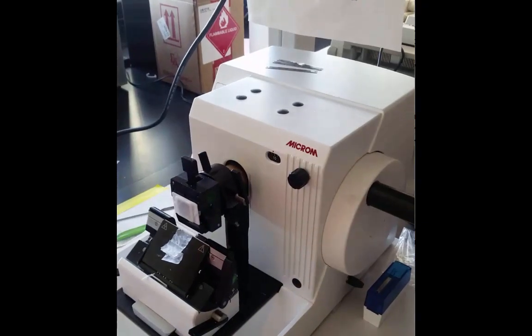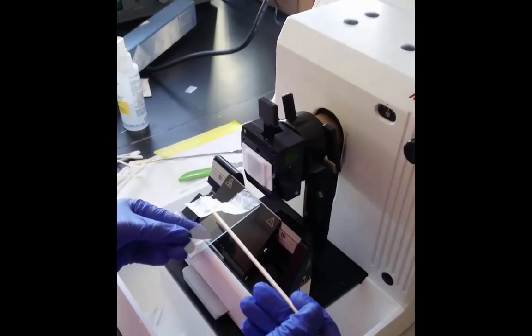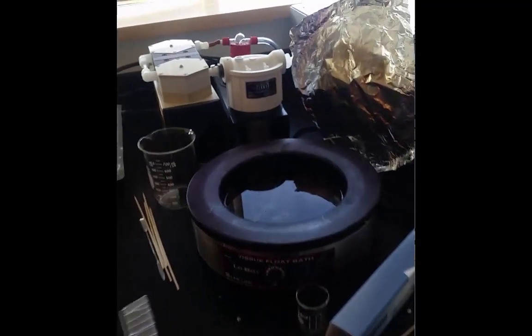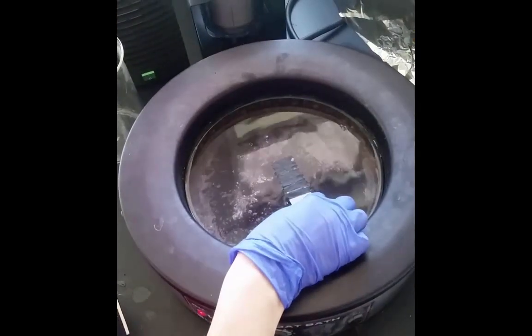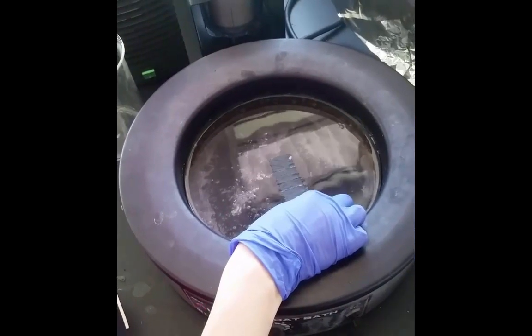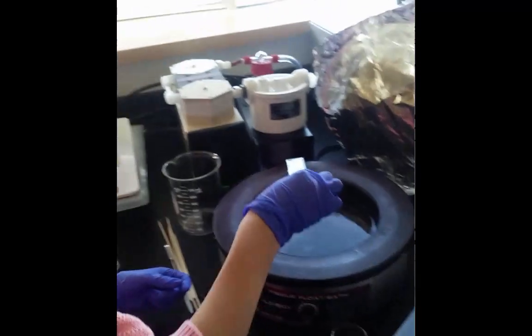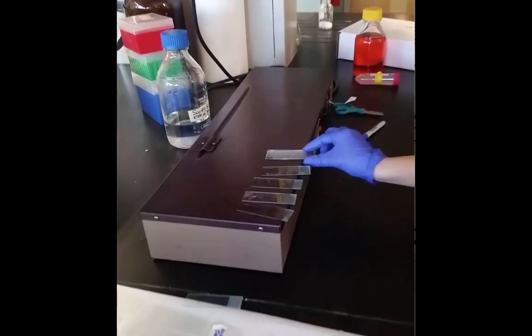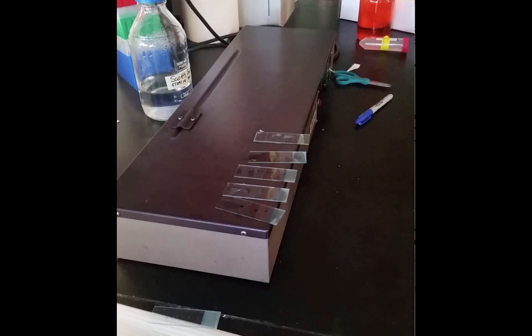The ribbon is then cut using a wooden tool and placed on a microscope slide. Do not use your fingers in the area of the blade. Then you'll transfer the ribbon to a warm water bath that contains gelatin, which helps the paraffin wax adhere to the microscope slide. Carry the microscope slide over to a slide warmer kept at 65 degrees Celsius and leave it there for 30 minutes. Then turn off the slide warmer and leave your slides at room temperature until they're ready for staining.